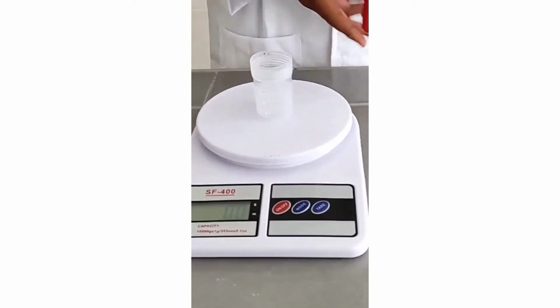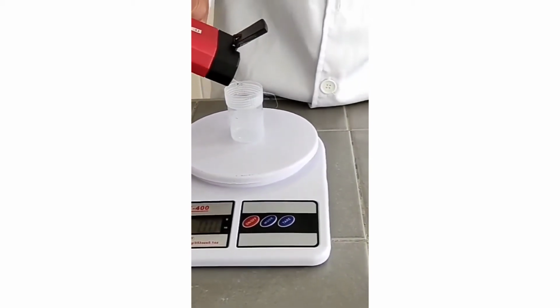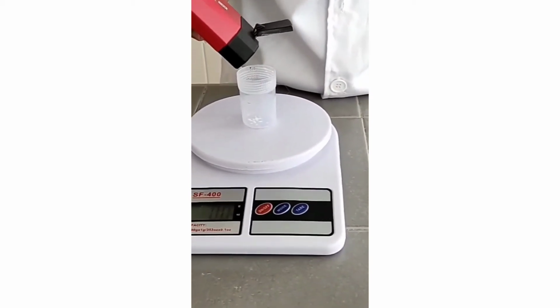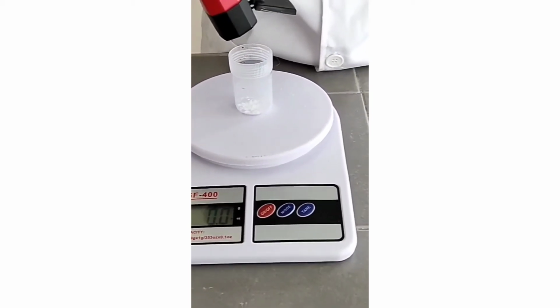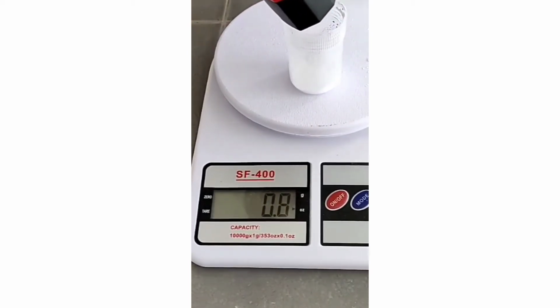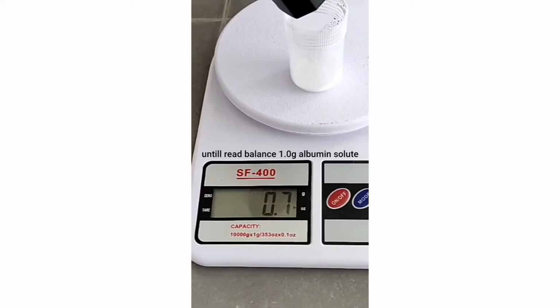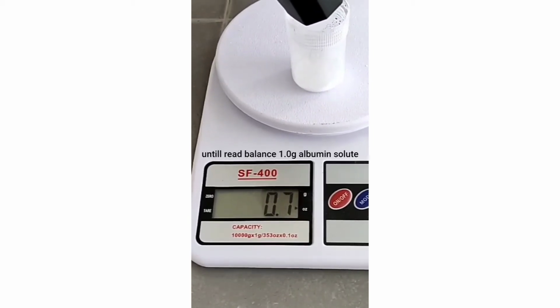After that we put the albumin solid in until it reads 1.0 gram. We put the albumin solid in again until the balance reads 1.0 gram.